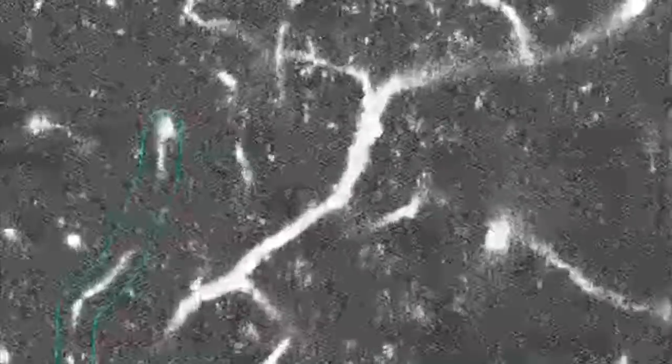To contrast, if you look at the vessel up here, we can see the little black spots moving as I move the scroll bar. But when I stop the scroll bar, you see black spots such as here and here. But that does not mean that it's a stalled vessel. You have to look at the video as a continuous flow, and that will be your indicator as to whether or not a vessel is stalled.